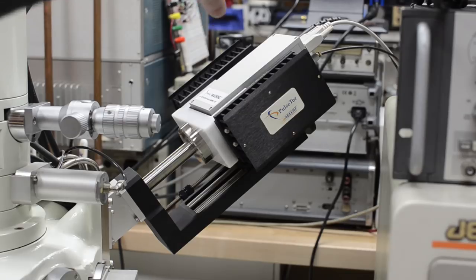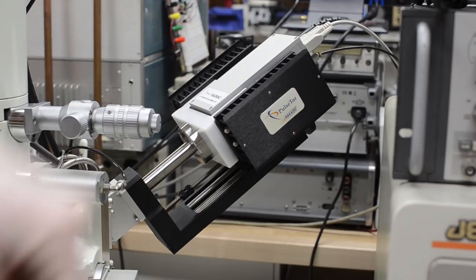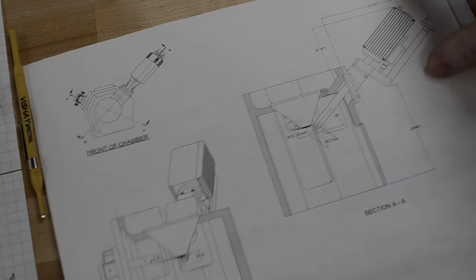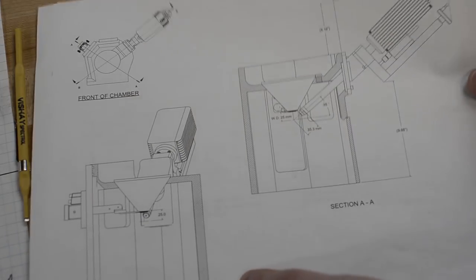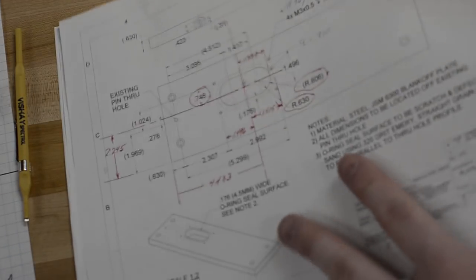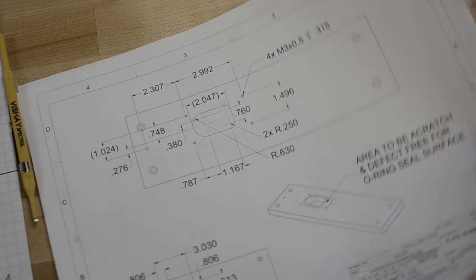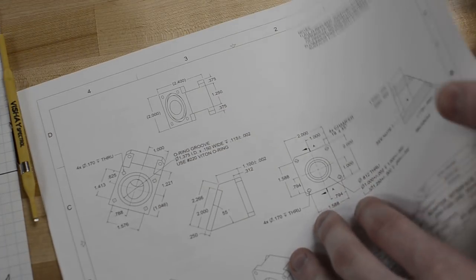This is the front or the back of the detector assembly. The detector tip is in the microscope, and there's a little crank wheel on the back you can spin to slide the entire detector. You would retract it, set up your sample, raise your sample to the right working distance, and then you can crank the detector back in so that the tip is close to the sample but not touching it.